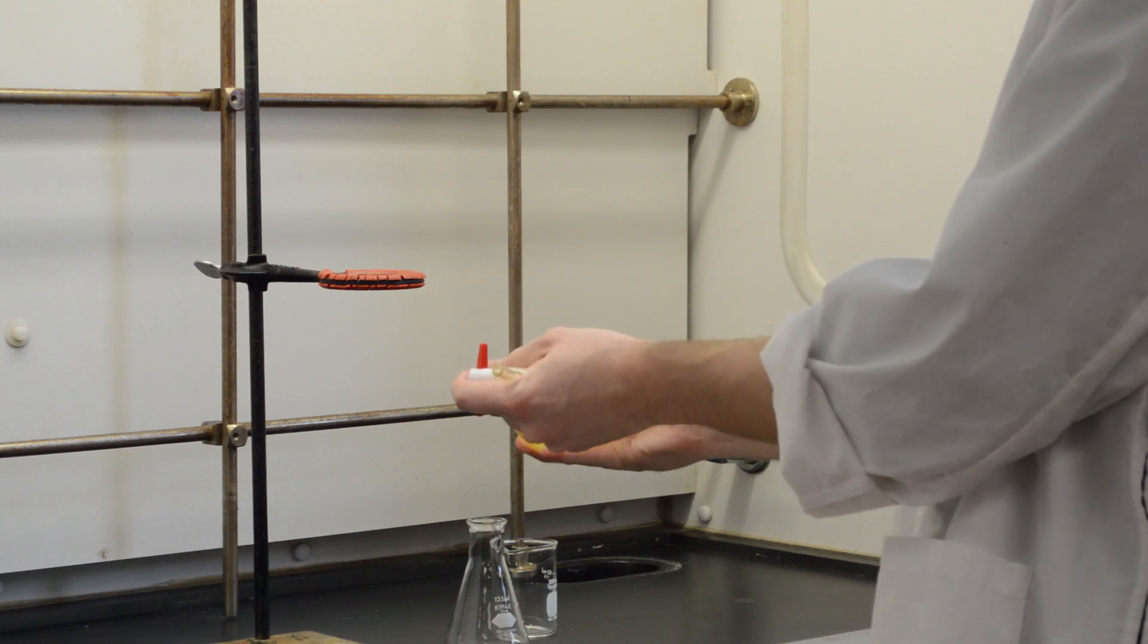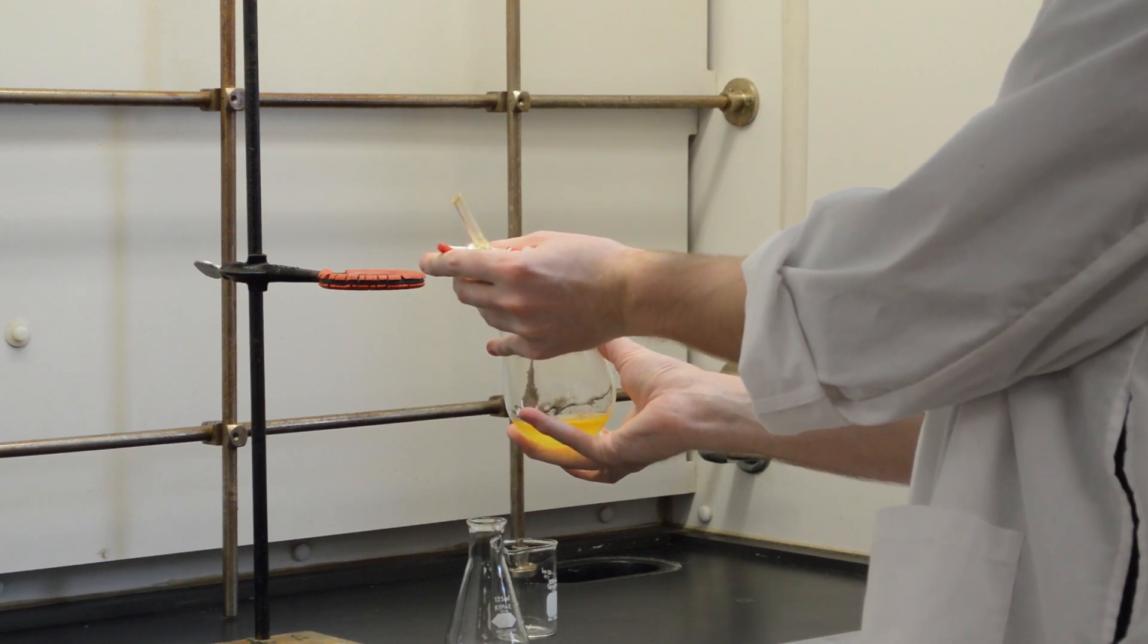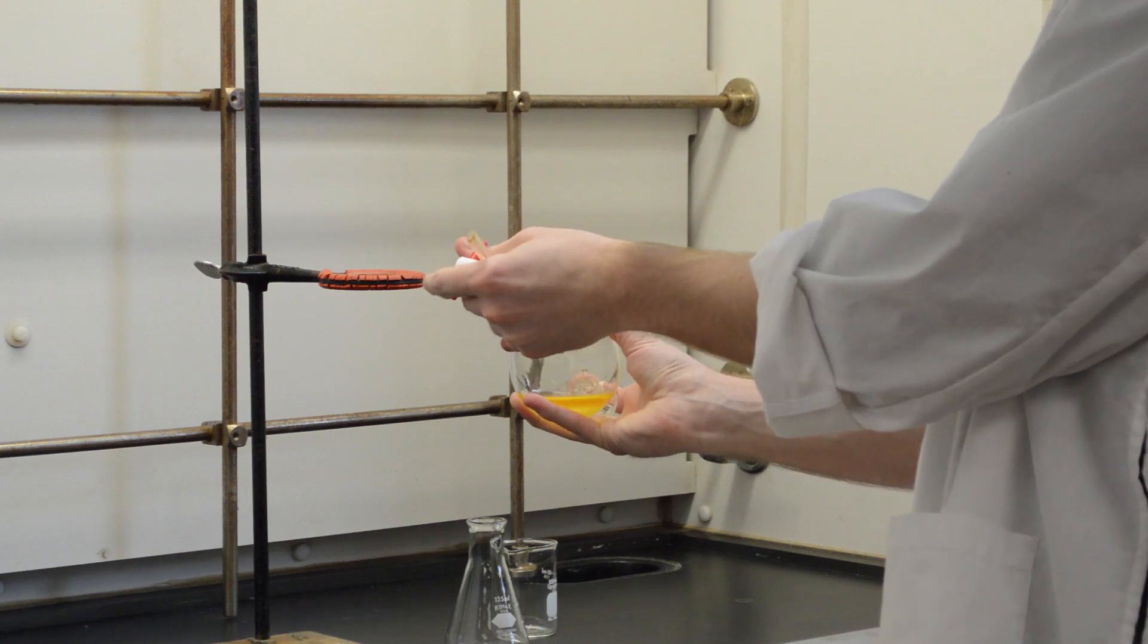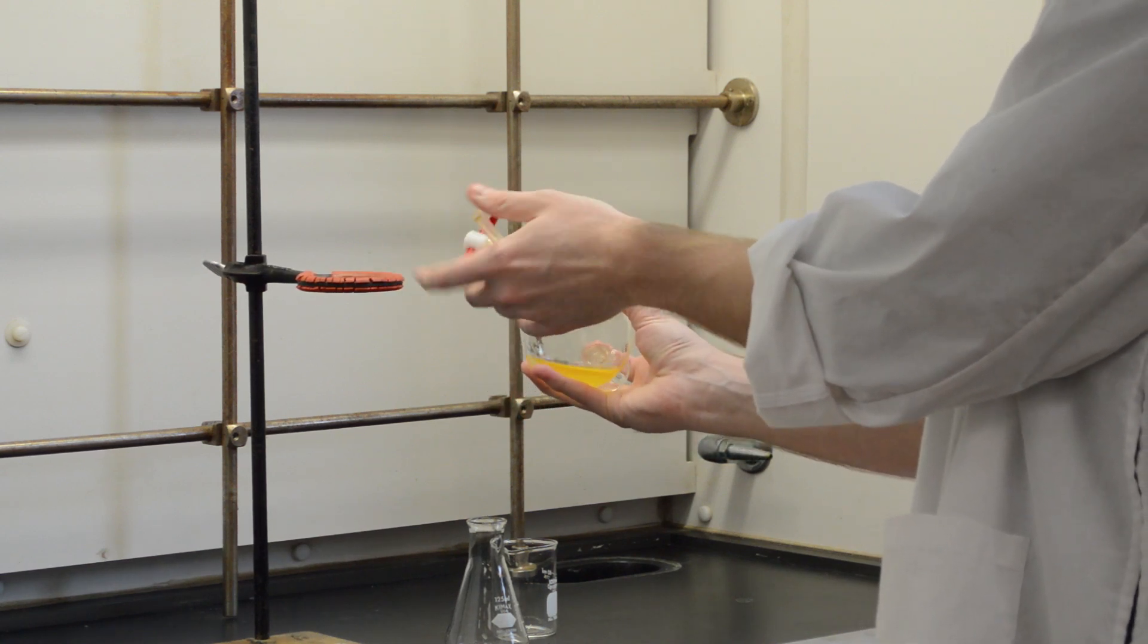You'll hear a hissing sound whenever you do vent it. You can shake it up a little bit, open up your end again and you'll hear this hissing. We can mix this multiple times until the hissing actually stops.